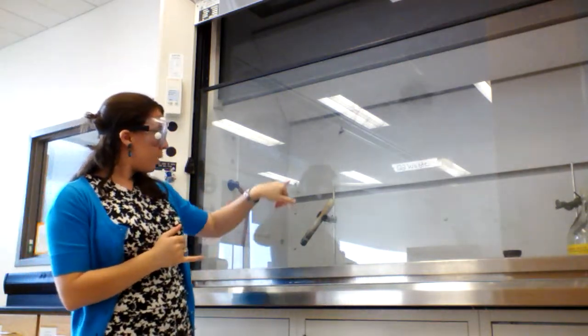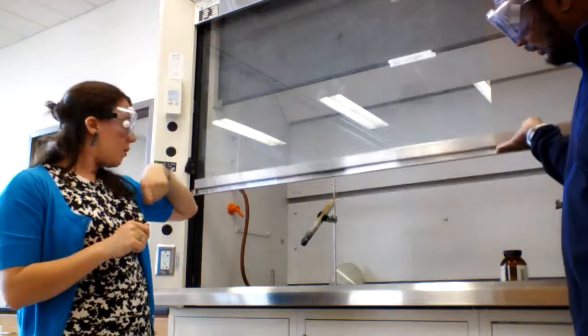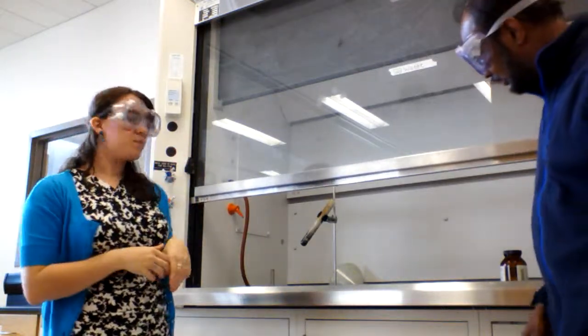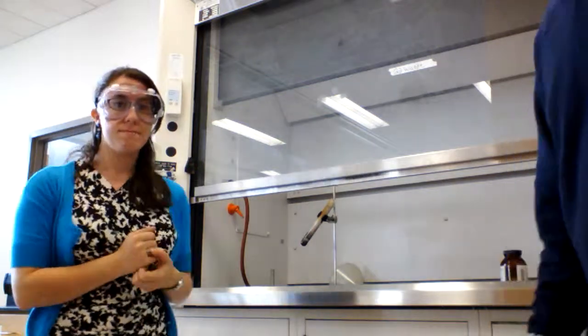The reason we had all those purple flames is because of the potassium ions that we started with in the potassium chlorate. So when we do a flame over something that contains potassium, we get those purple colors. Here's what makes this one a little bit different than just burning a gummy bear by itself.